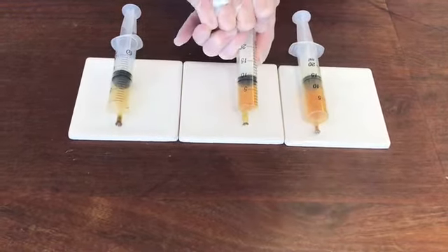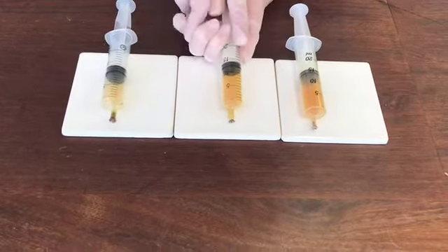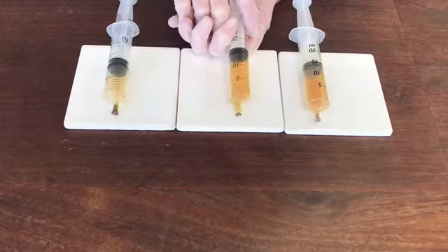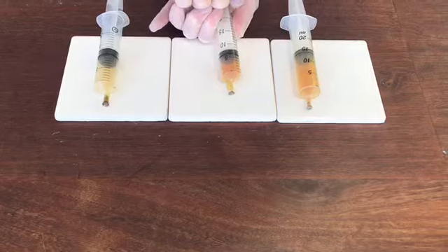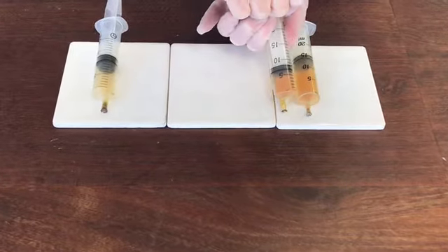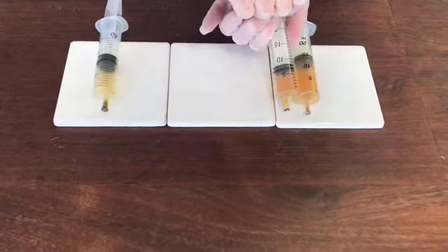All right, I'll let it expand again and we'll try to see it a second time. Okay, I think they're about the same colour now. So I'll squash it down, we'll see it darker, and then we should see it get lighter again. So it went darker, and I think it's still in the process of just lightening up, and now it looks like it's the same colour as that other syringe again.